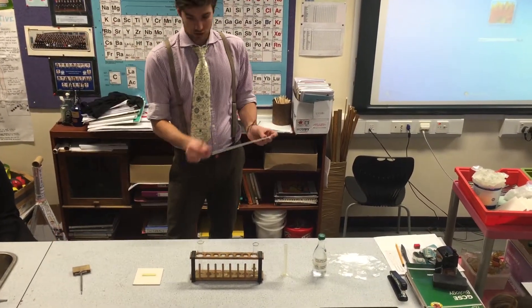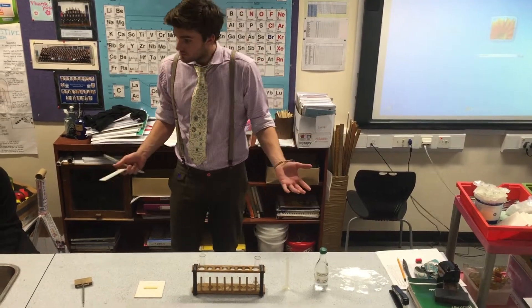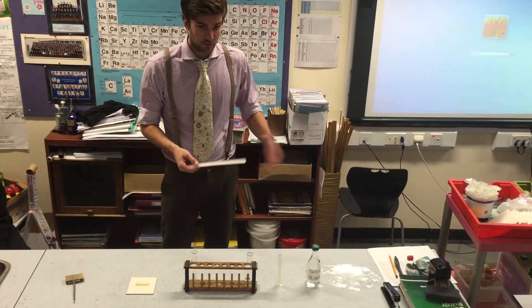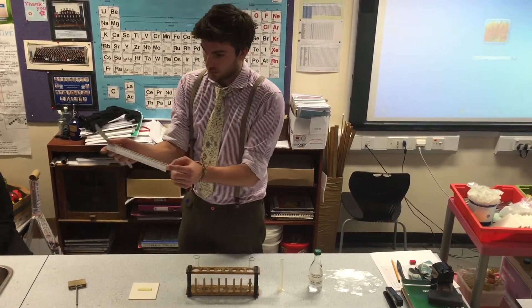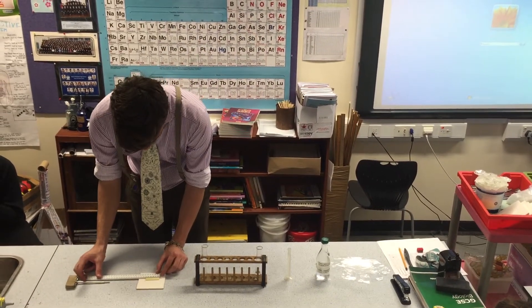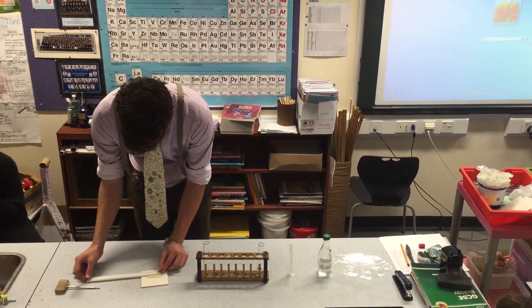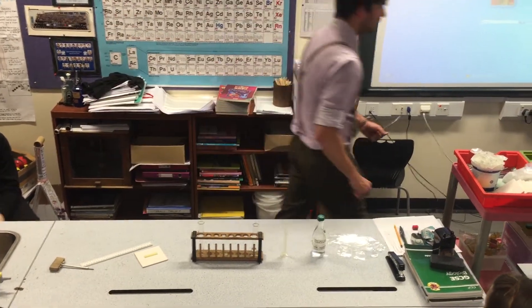Then you need to make a note of your potato size. It's not necessary to all have the same potato size, but you need to make a note of it. So using my ruler, I'm going to use millimeters, a bit more accurate. I'm going to measure this, and they are both 55 millimeters long.